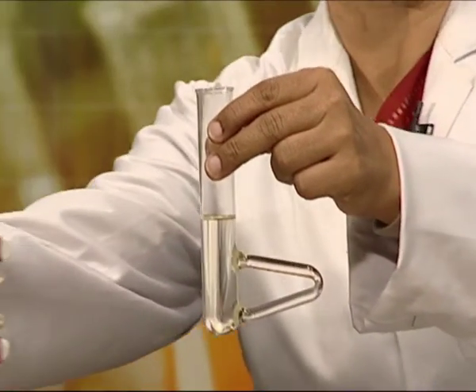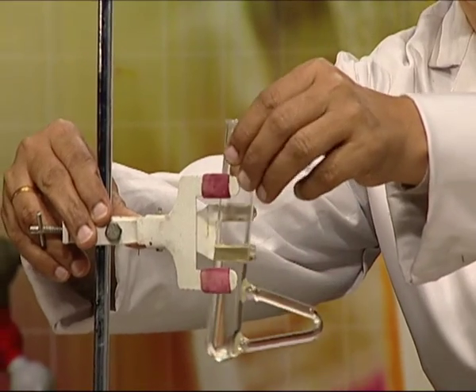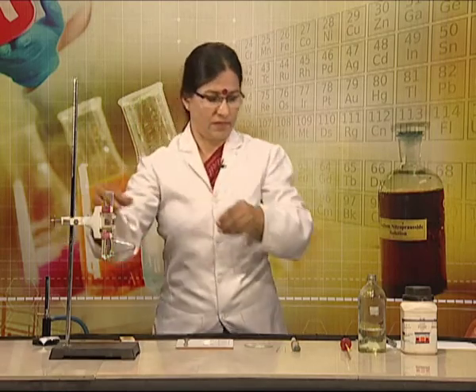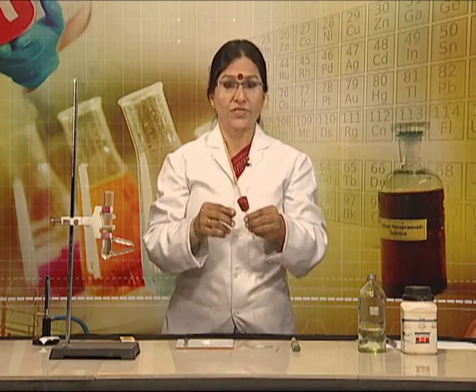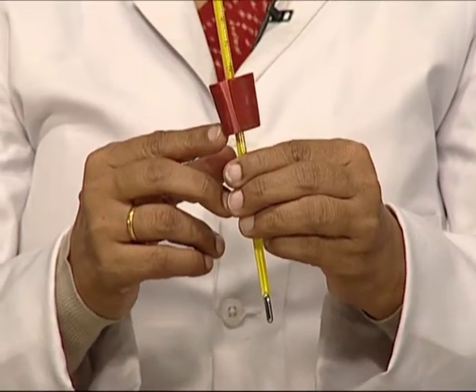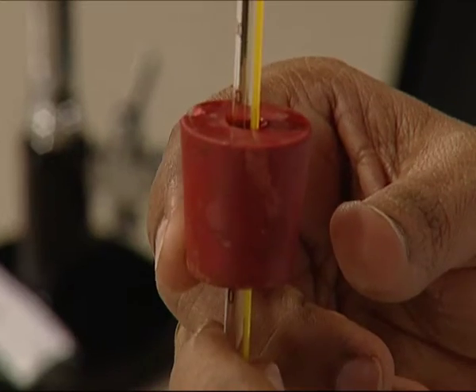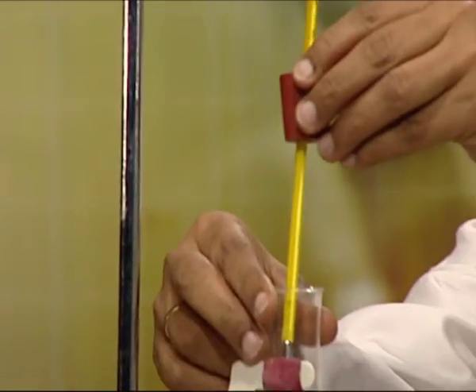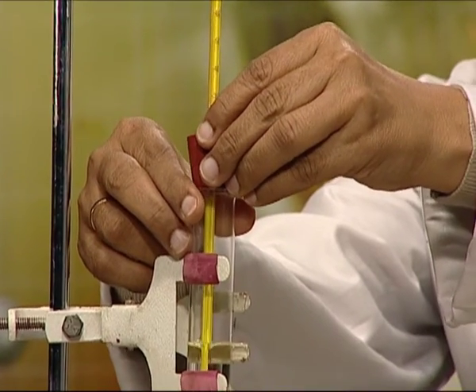Now we will fix the Thiel's tube on the iron stand with the help of the clamp. The thermometer fitted with a rubber cork having a groove on its side for the escape of air and vapors will be fixed inside the tube which is filled with liquid paraffin.